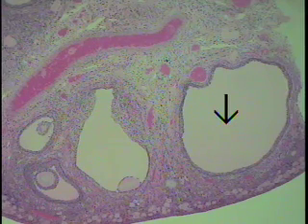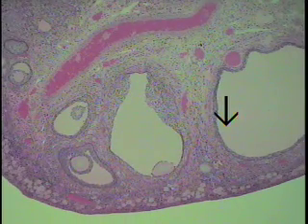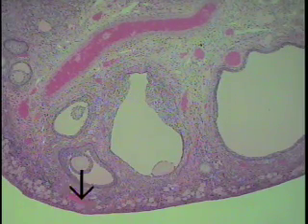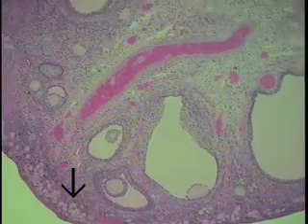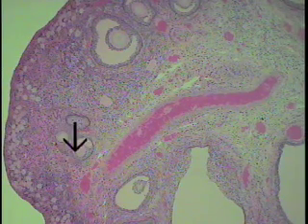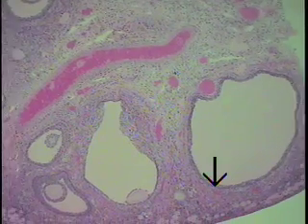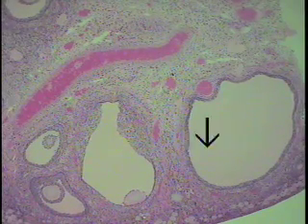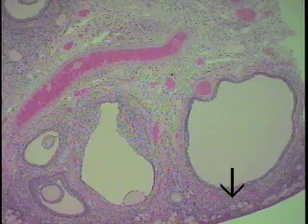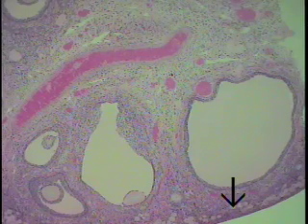I have now moved back to the scanning objective to show you, once again, the follicular stages of follicular development. The primordial follicles are located here. Moving over slightly, one can see the progression of the maturing follicles as they grow — primaries, then secondary follicles, an early one, a later one, and then finally getting over to the very mature graafian follicles. These are the types of follicles which will rupture through the surface and liberate the ovum at the time of ovulation.